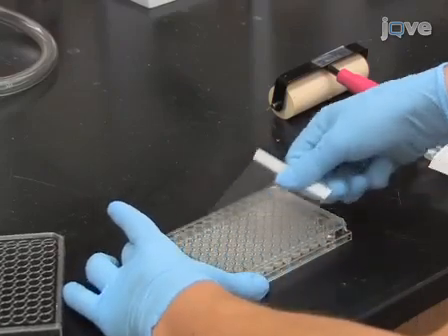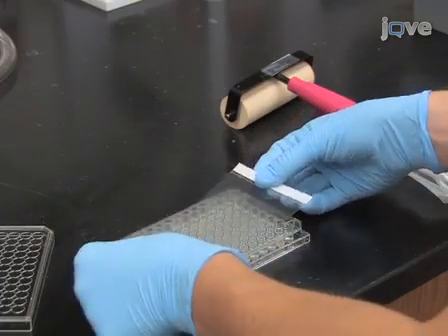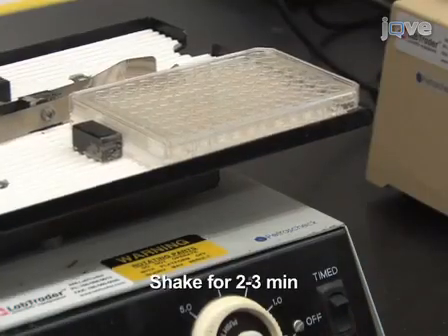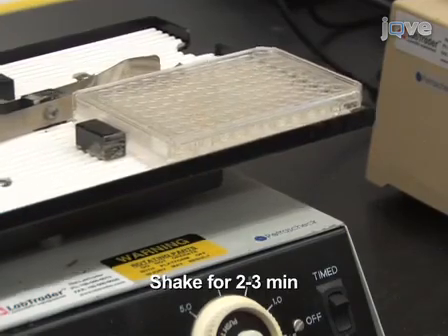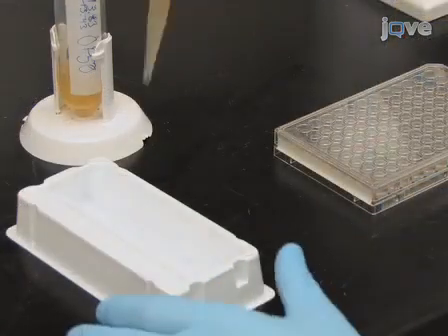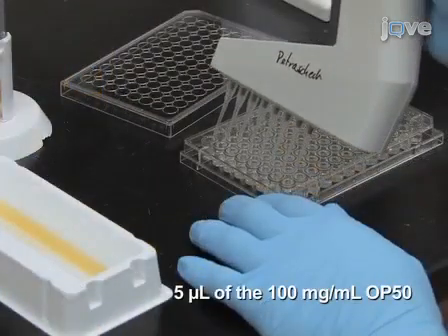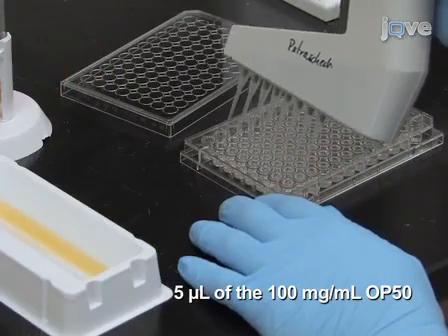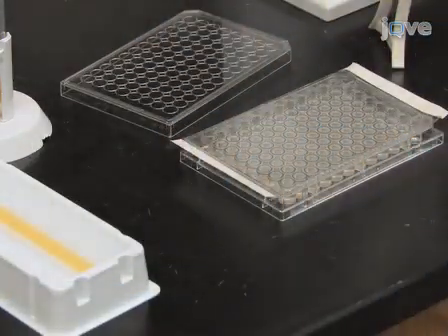To allow fresh oxygen to enter the culture, remove the sealer. Wait 1 minute and reseal the plate. Shake the plate for 2 to 3 minutes on a microtiter plate shaker. Repeat once every week. On day 5 of the adult lifespan, add 5 microliters of the 100 mg per milliliter OP50 solution that was prepared earlier to each of the 96 wells to prevent starvation.